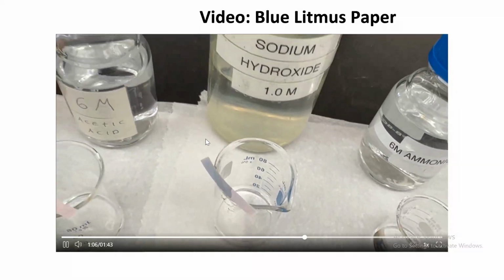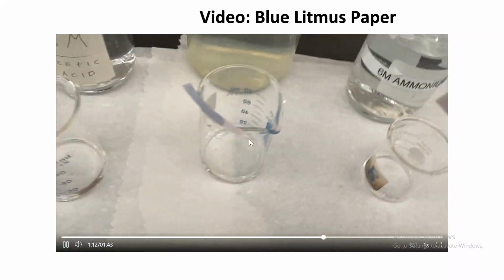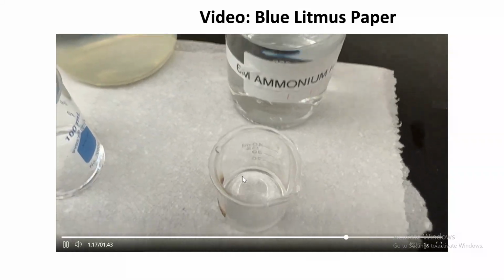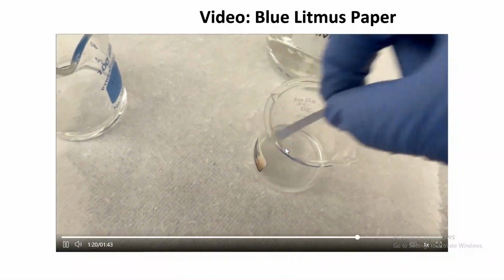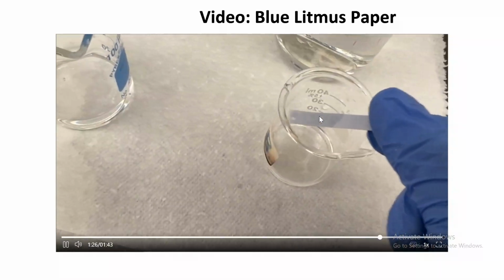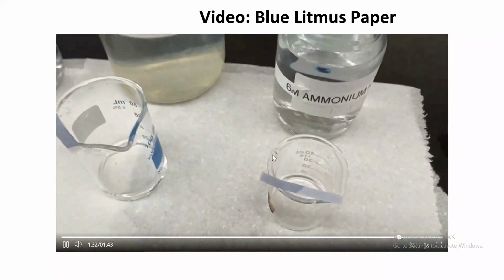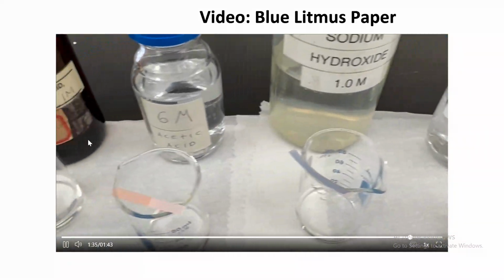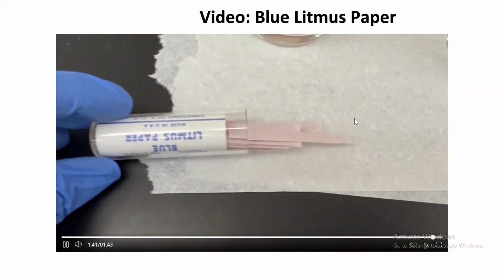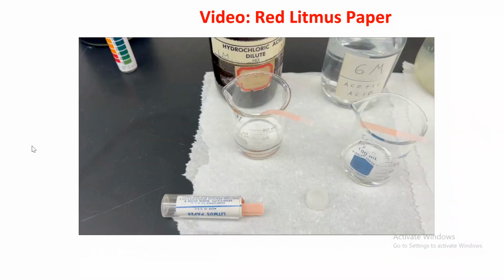So the first two were red. See that? Let's focus. Red, blue. You can see the distinction. Blue litmus, right? And ammonium hydroxide, which is a base. Look at the color. Very blue. So blue litmus was red, red, and then blue, blue. So beaker A red, beaker B red, beaker C blue, beaker D blue. So acetic acid and hydrochloric acid, they turn red, and for the bases they turned blue. All right, so that was experiment number one.